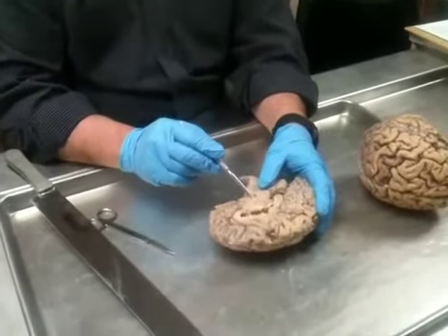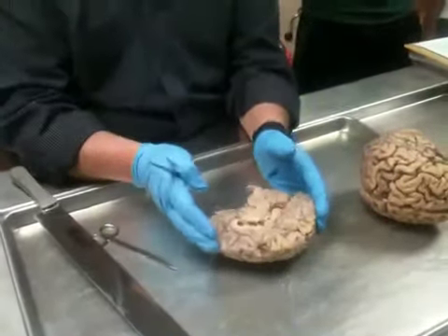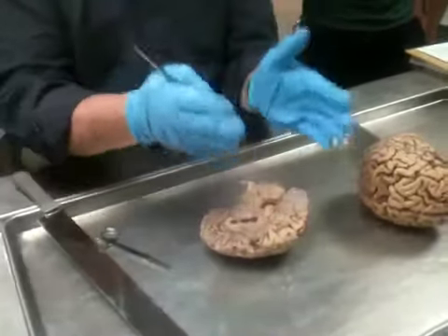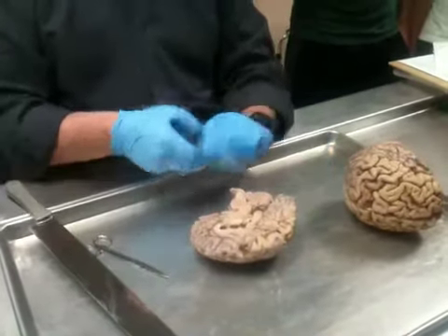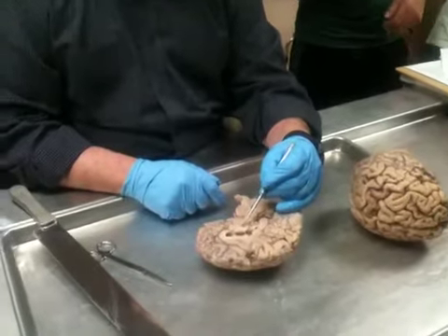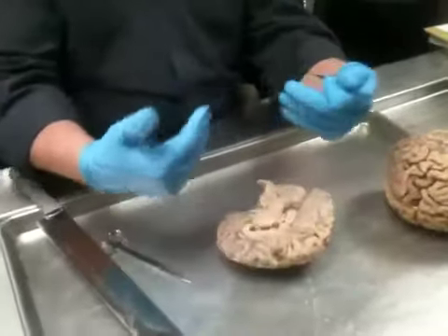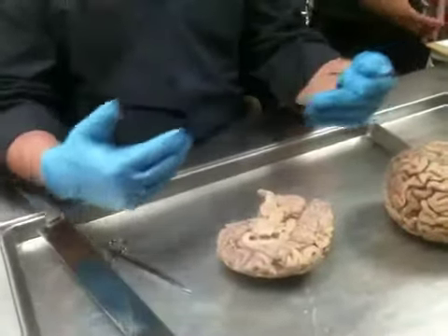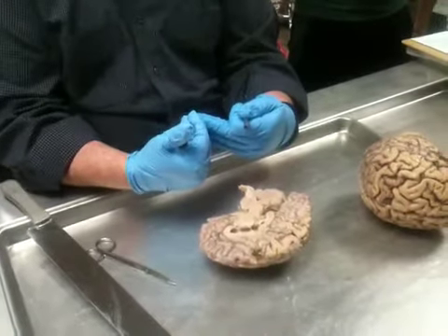And remember, that's the point that I'm going to use as a landmark, because that interventricular foramen, when we cut through this, is going to mark a number of different landmarks. It's going to be at the anterior pole of the diencephalon, or the anterior pole of the thalamus. When we get into it, it's going to be at the genu of the internal capsule, where the internal capsule comes all the way to the ventricular system.